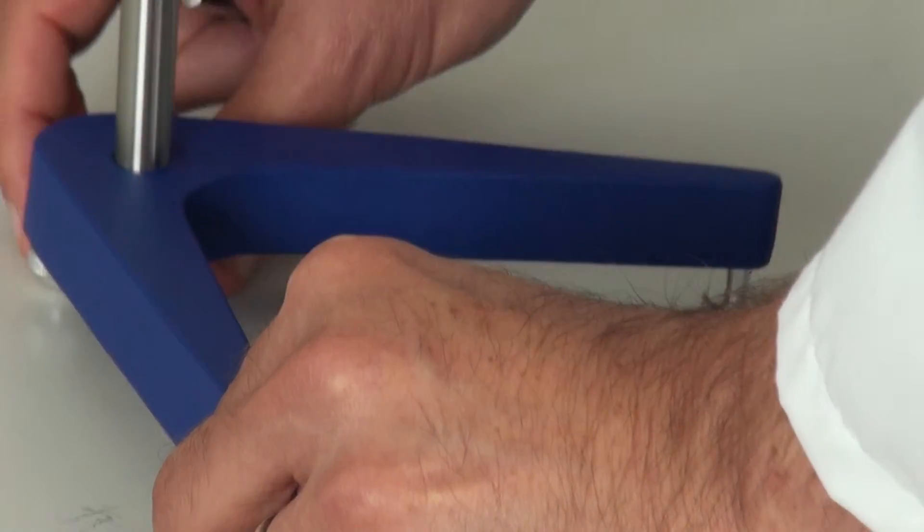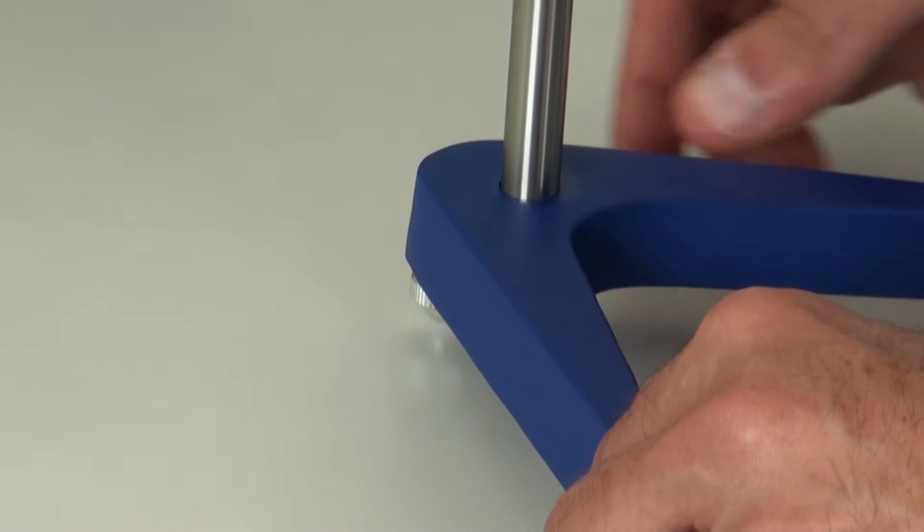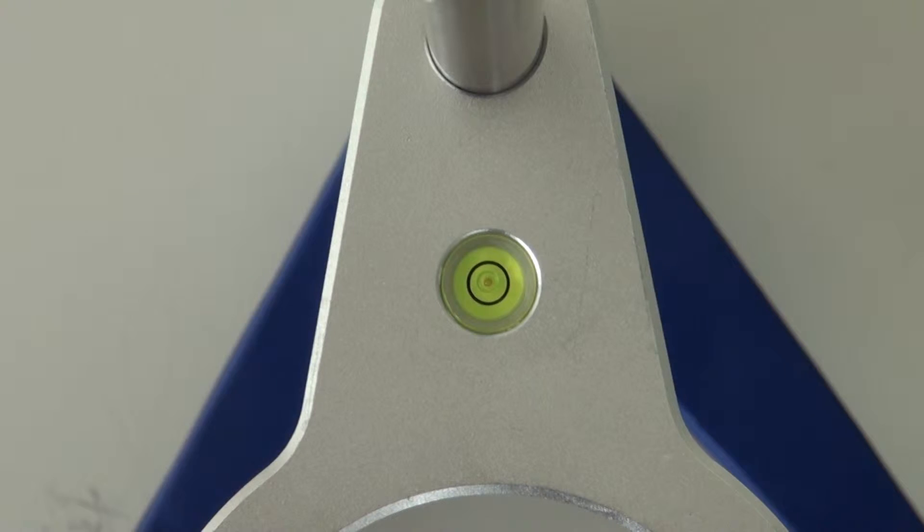Then the stand can be leveled using the three turnable feet. Now the stand is leveled and ready to use.